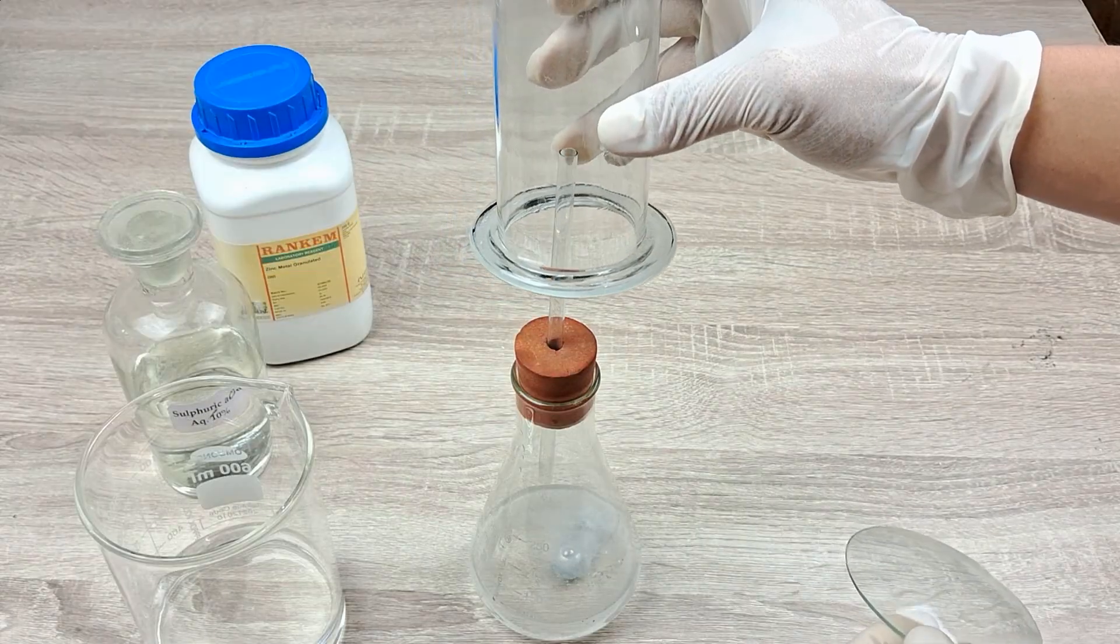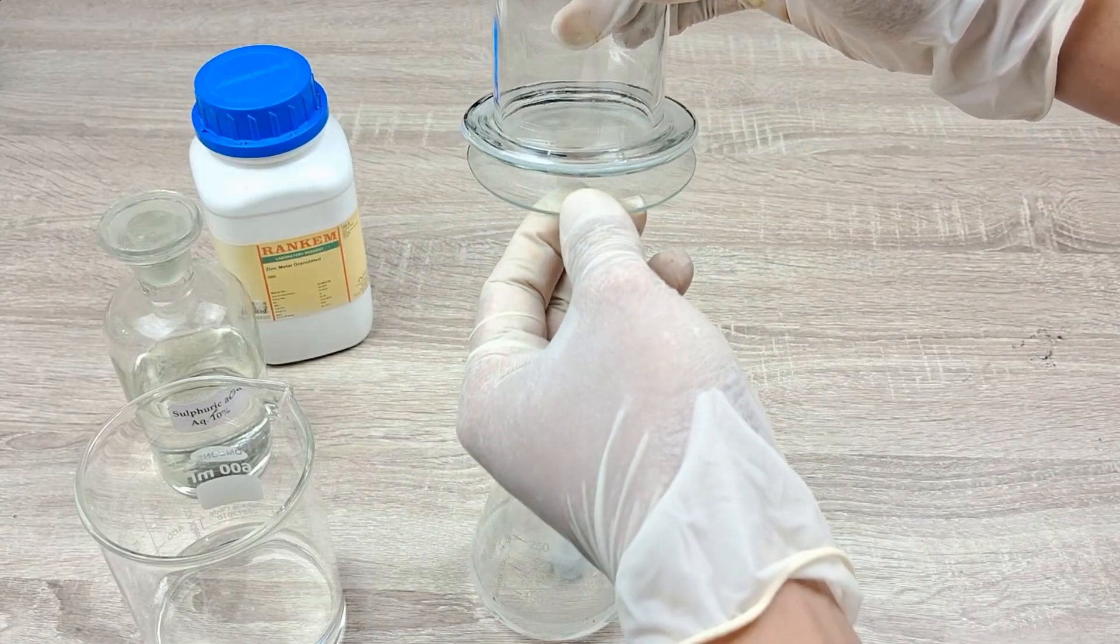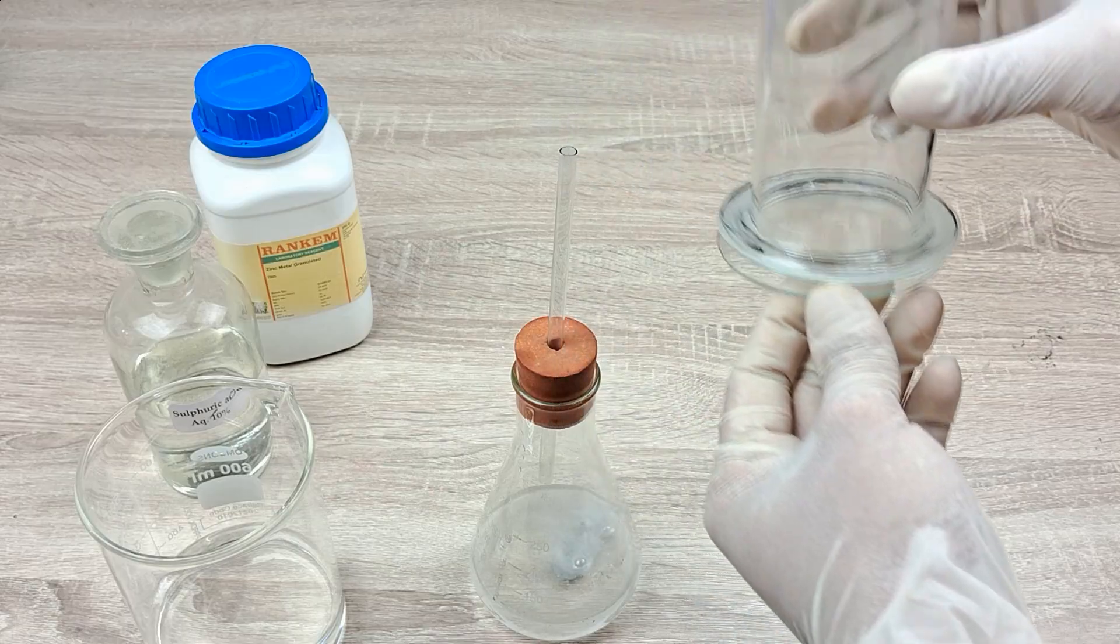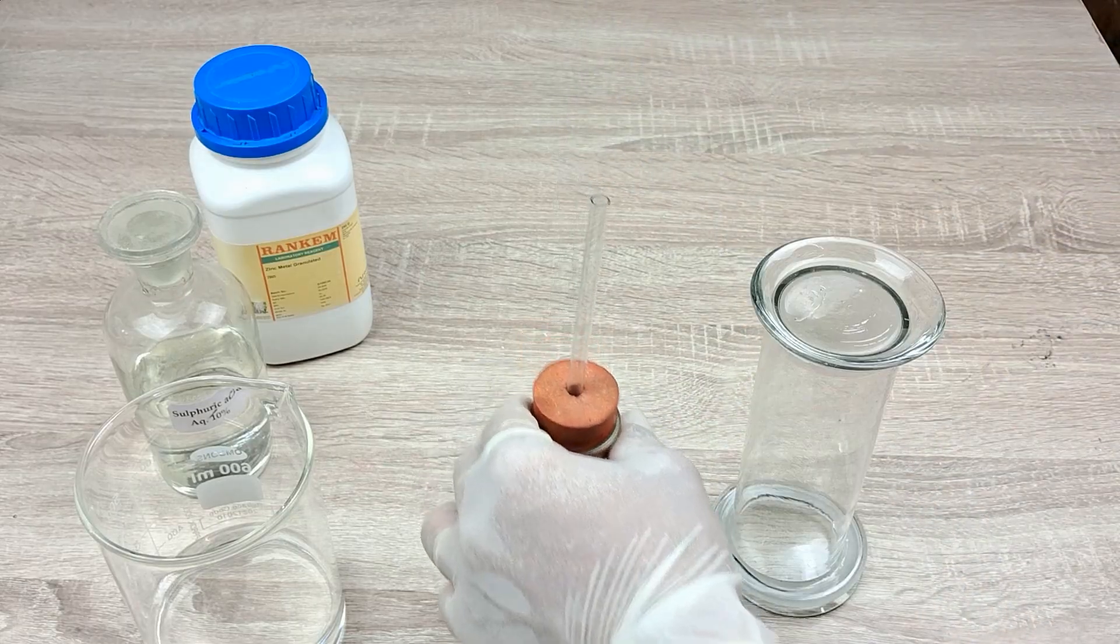Now, cover the mouth of the gas jar with a glass lid while still holding the jar inverted. Remove the reaction flask away at a safe distance.